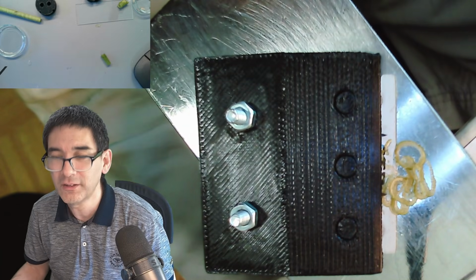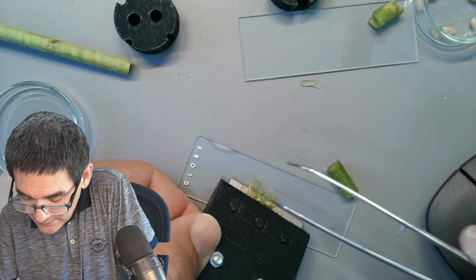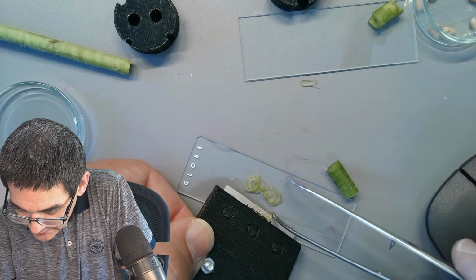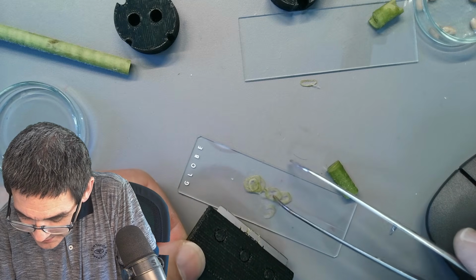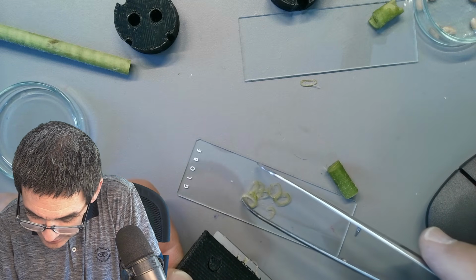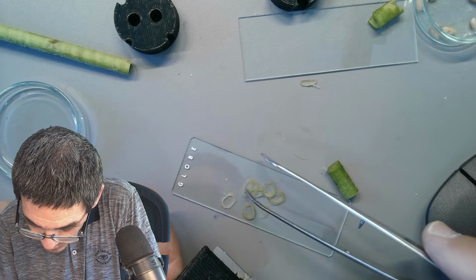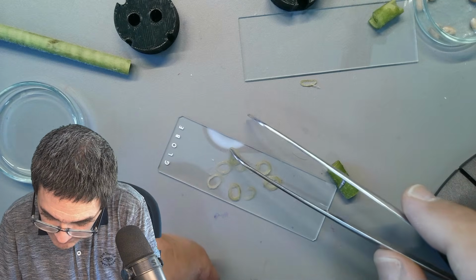Let's give it a try here as well, just like before. So here we go again. Of course, freezing is also always a little bit dangerous because it damages cells. Freezing water, ice expands and might crack cells open.